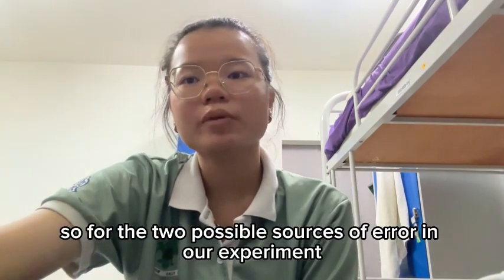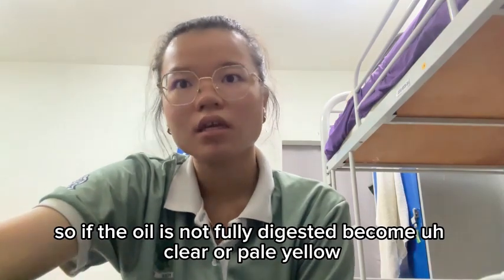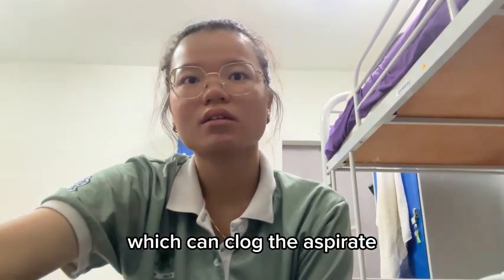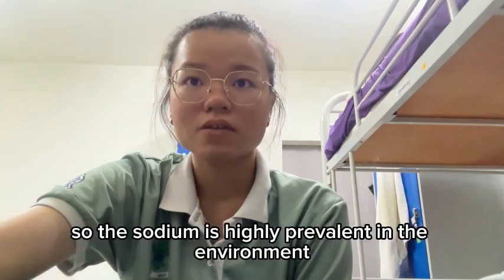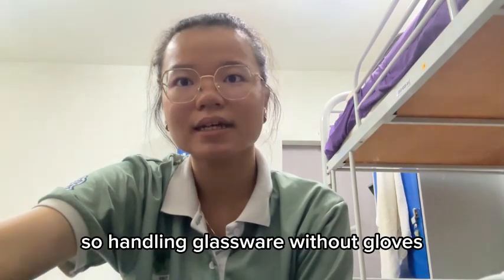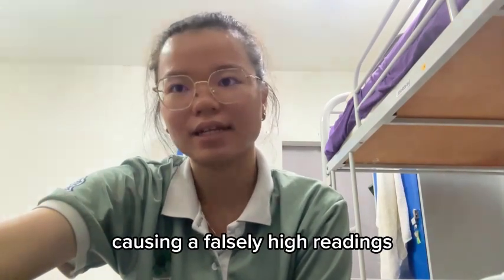For the two possible sources of error in our experiment, the first one might be incomplete digestion. If the oil is not fully digested, becoming clear or pale yellow, the organic particles may remain, which can clog the aspirator or interfere with the flame stability. Another error might be contamination. Sodium is highly prevalent in the environment, including the skin or sweat. So handling glassware without gloves or using glassware that was not properly rinsed with distilled deionized water can introduce external sodium, causing a falsely high reading.